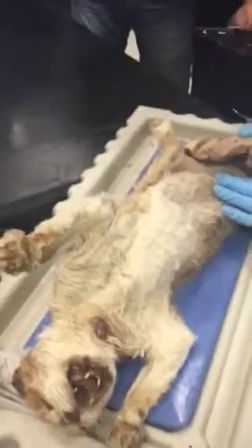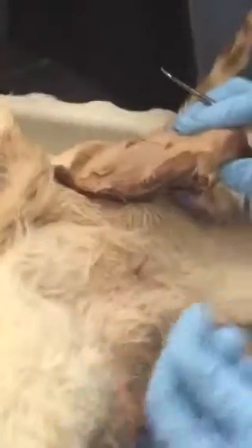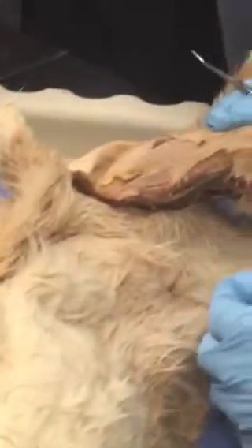This station is mainly there to test your understanding of the leg muscles. If I use one of my questions for the sciatic nerve, I lose part of the ability to test you on the muscles. But I can still test you on that there.